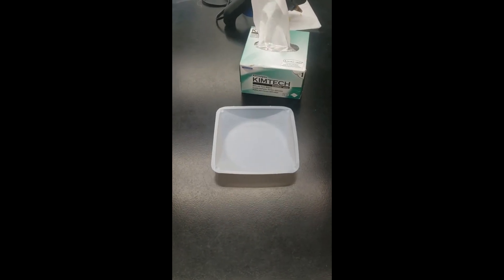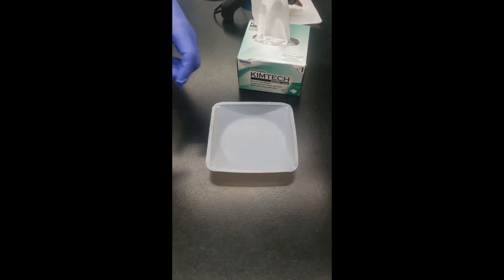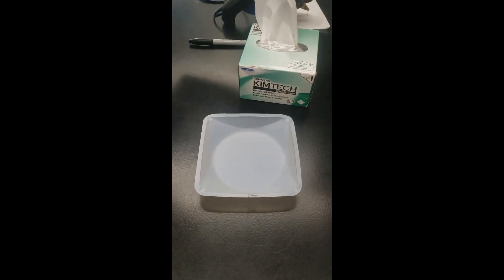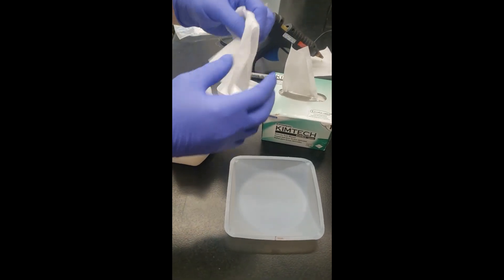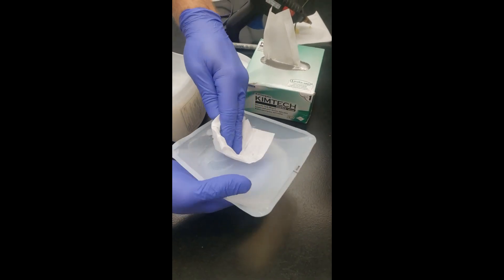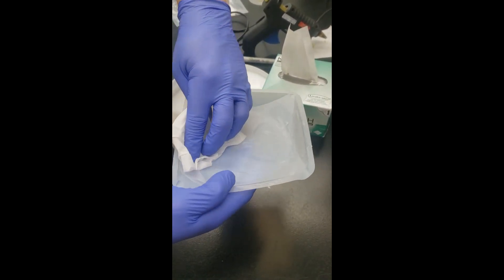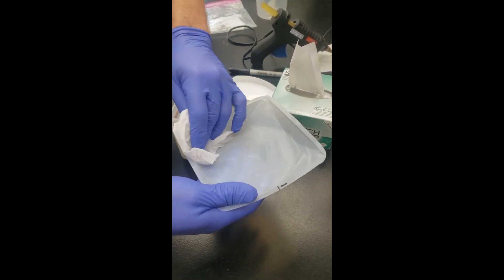Make your test containers. We'll also have to make the weighing containers. Dave will label this one with a number one on the edge — on that flat edge, that's where we want to label it. Then smear some petroleum jelly. Use a little tissue to scoop some out and apply a thin layer. You don't need too much, but a good coating is good. You want to get it all over the sides and bottom so that Varroa will fall and stick to it.